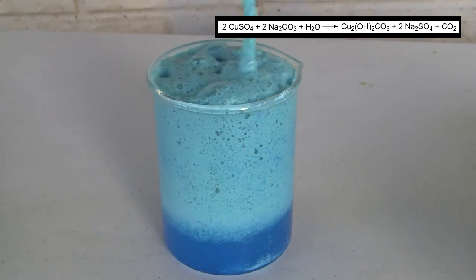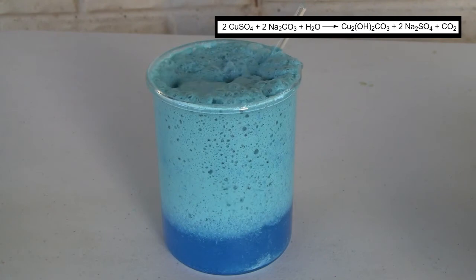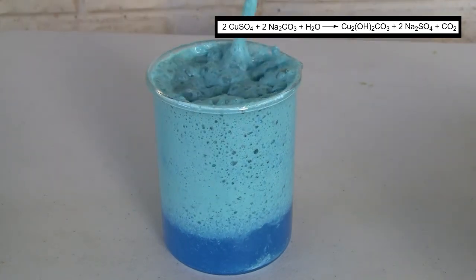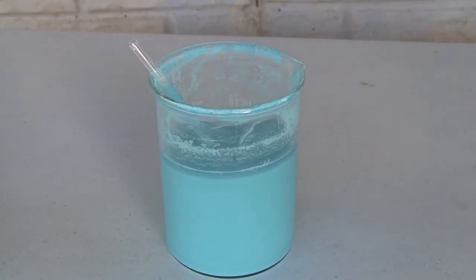If sodium bicarbonate is used instead, three equivalents of CO2 is produced instead of the one equivalent produced in this procedure. Once all sodium carbonate is added, the solution is stirred and allowed to sit for a few hours to finish reacting.